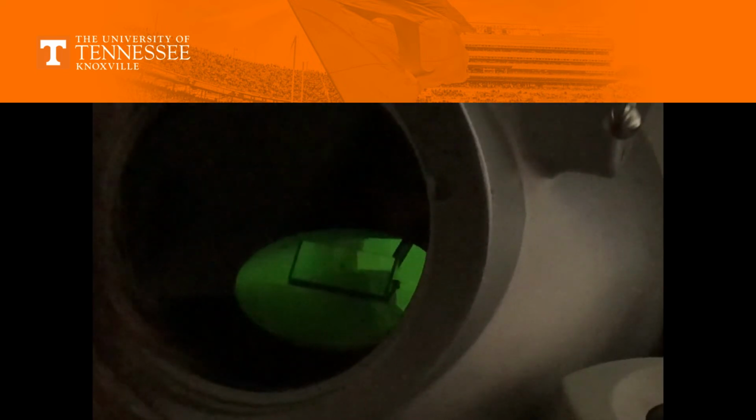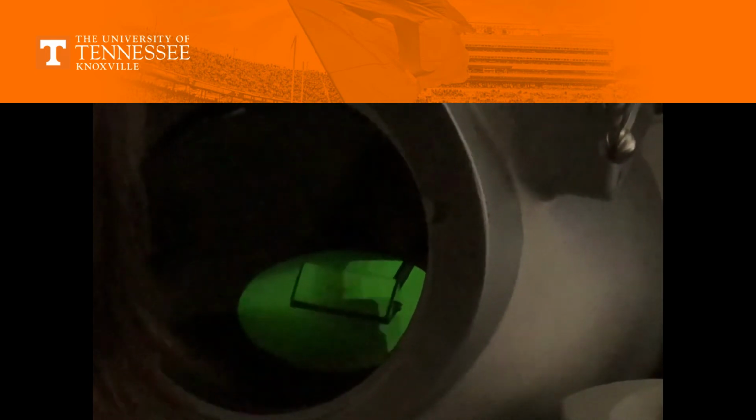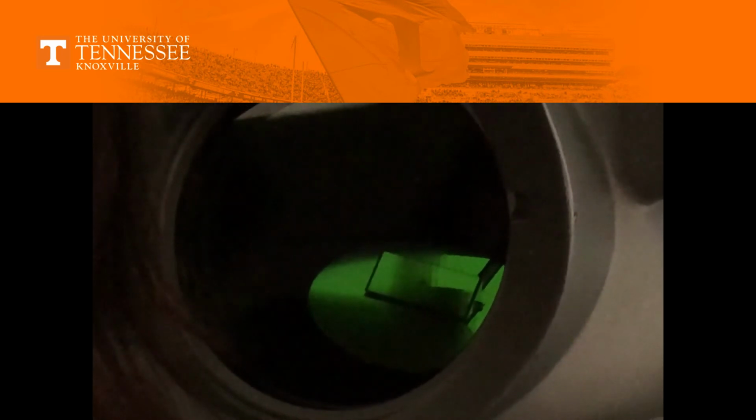Next, the illumination tilt alignment. Under the TEM tab, click Objective Wobbler. Then, you'll see Illumination Tilt will be active on the keyboard. Adjust X and Y to minimize the wobble of the image. You basically see two after images that you want to converge on each other. When you're finished, click Objective Wobble off.